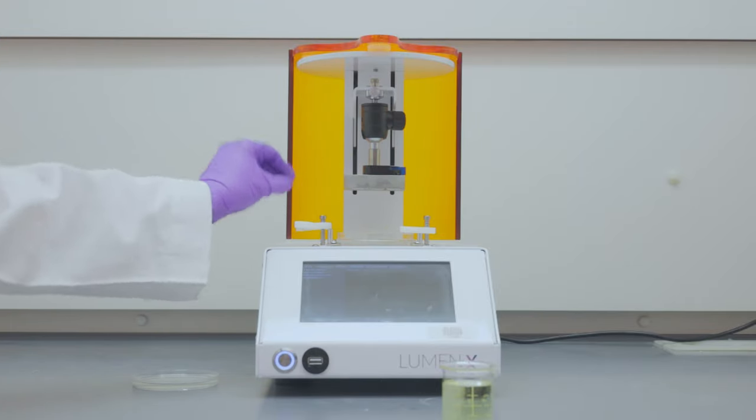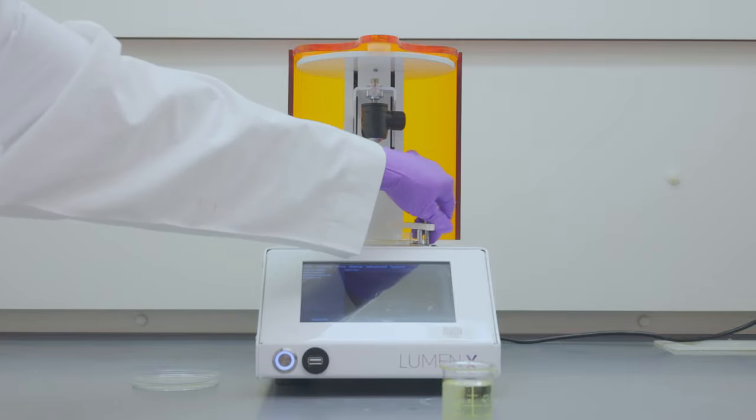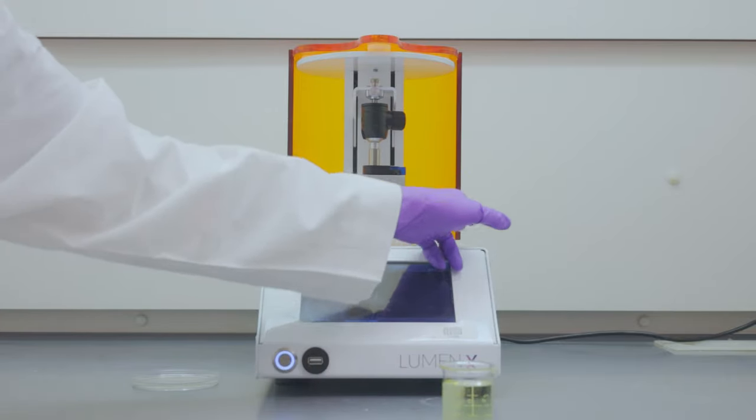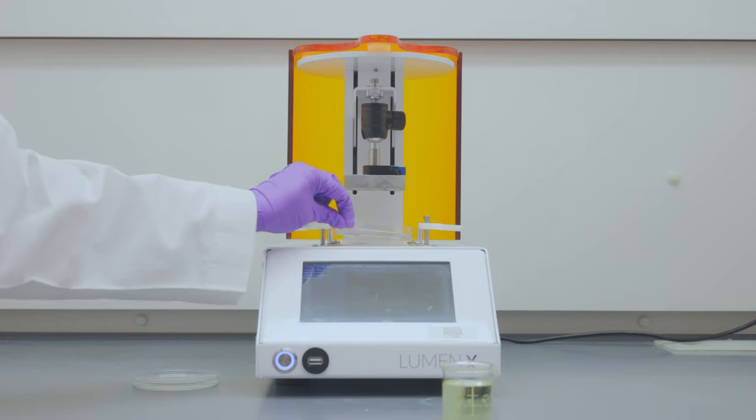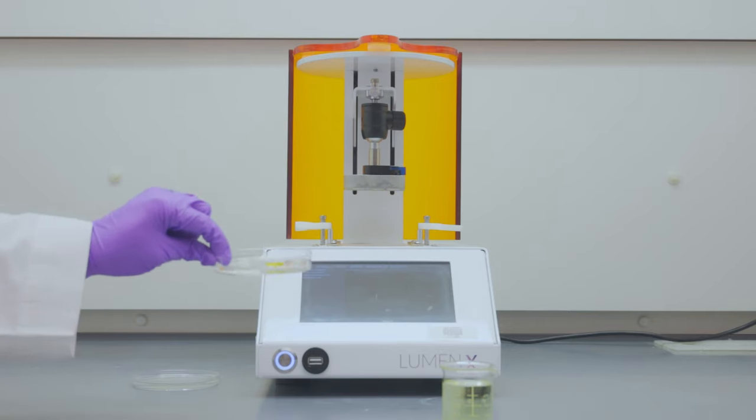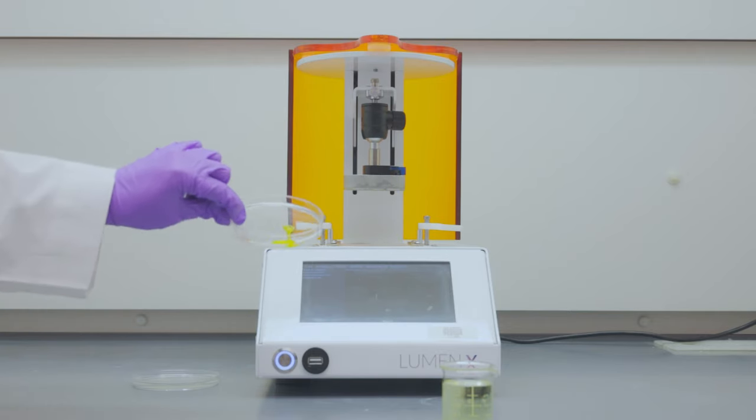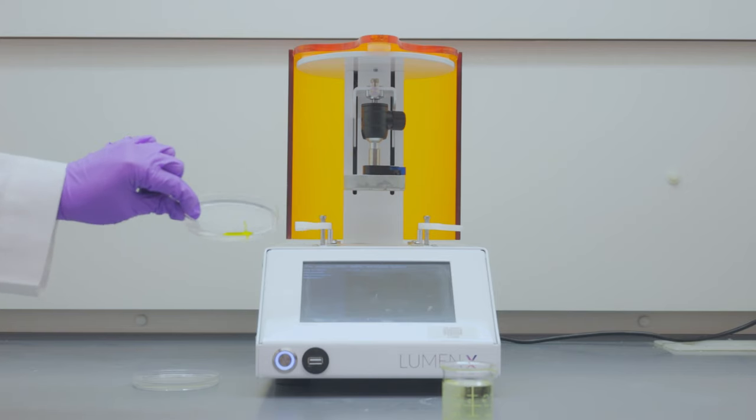And remove the PDMS-lined vat. We can save the photo ink or discard it properly. The PDMS-lined vats can be cleaned using DI water.